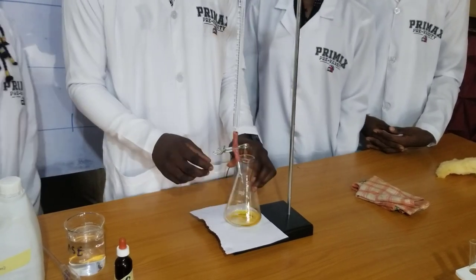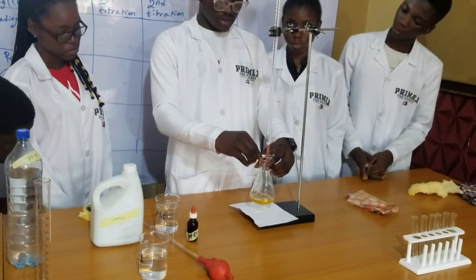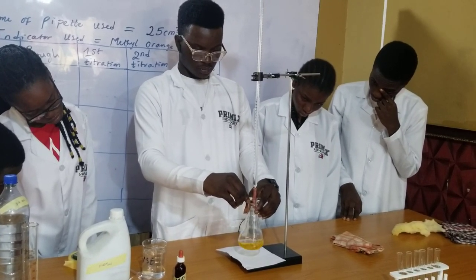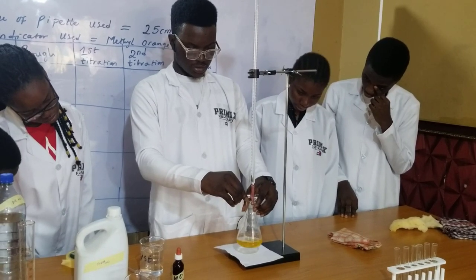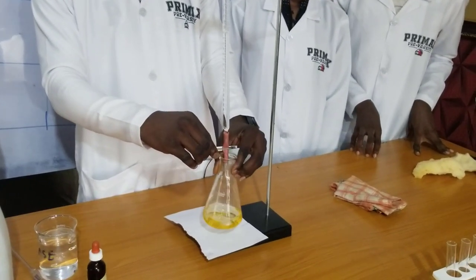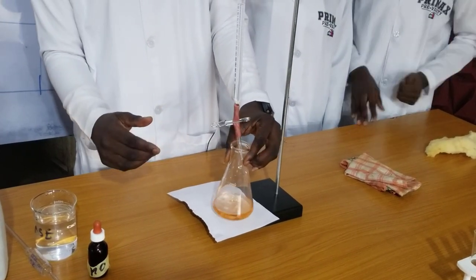You release your acid. For the reaction to mix properly, you have to continue to shake while you are carrying out the titration. You release the acid, and at the point where you are going to see a color change, you stop releasing the acid. You can see now that we have a color change.